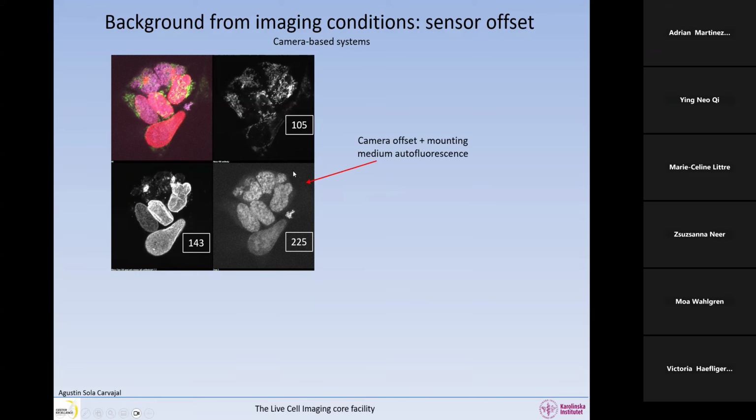So in this image, we have the camera offset, and we also have mounting medium autofluorescence. And why do we have this camera offset? It works a little bit different from a single point confocal. The camera's electronics cannot deal with 0 values. That means that the camera manufacturers always add an offset. So we never start at 0 with a camera. Whereas in a single point confocal, we could have an image that is 0. If you turn off your laser and you get an image, you will get very, very close to 0 with a single point confocal. But on the camera, you can't do that. You take one image with no laser, your value will be around 100, and that is called the camera offset.